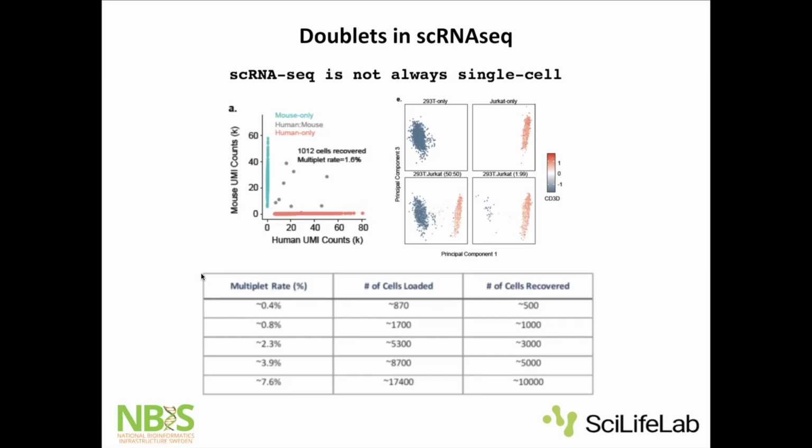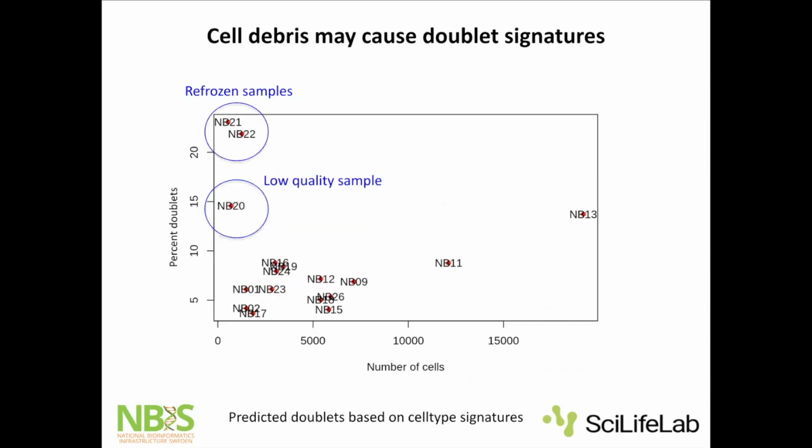They've done experiments with mixed samples and so on to estimate the doublet rates for their different protocols, which you can have a look at on their website. But in this case, it's a very clear example with human and mouse. Most of the cells map to either only human or only mouse, and then you have some cells in the middle that are mapping to both species. But it's not always that simple.